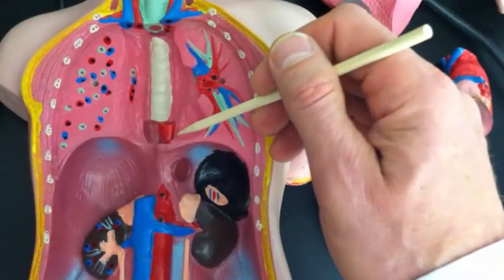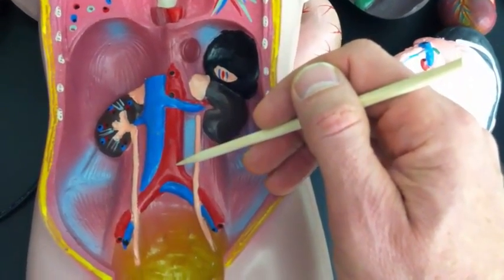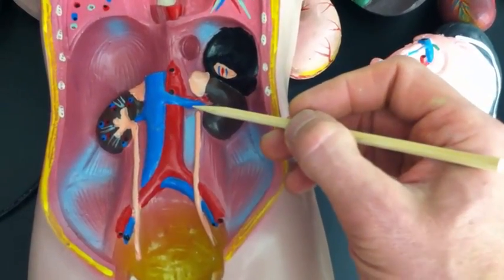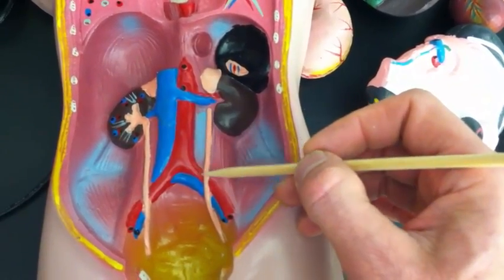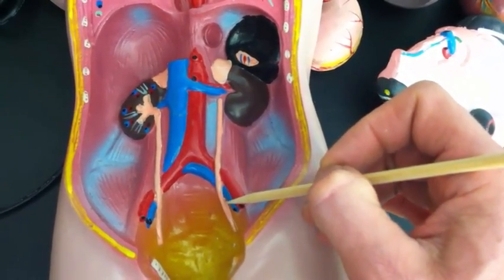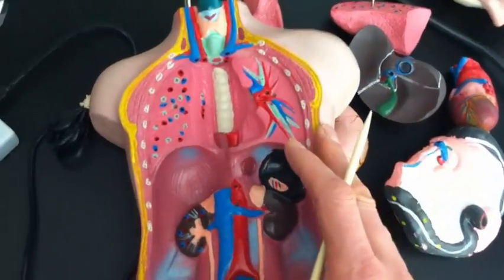Back in here, you get the top part of the thoracic aorta, and then down in here, of course, we're in the abdomen, so this would be abdominal aorta, and this would be inferior vena cava. We've also got left renal vein and left renal artery, and then down here at the bottom, where the aorta branches, we've got the left common iliac artery, left iliac vein, right common iliac artery, and right iliac vein. And that's about it on this nifty little model.